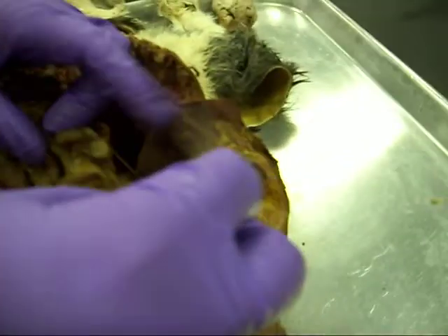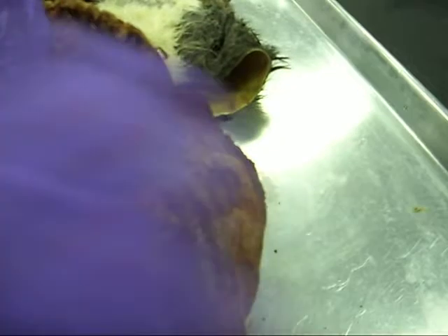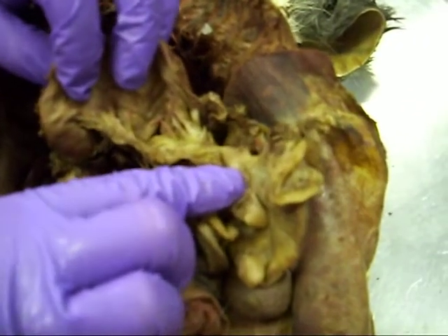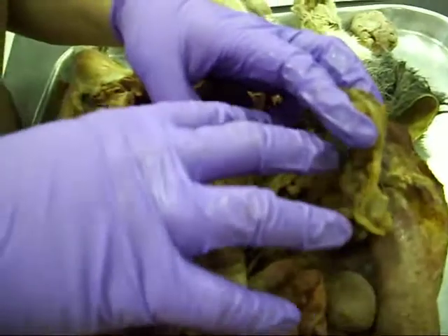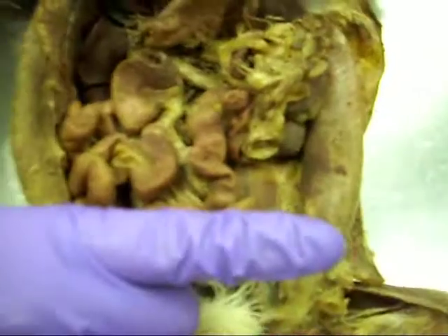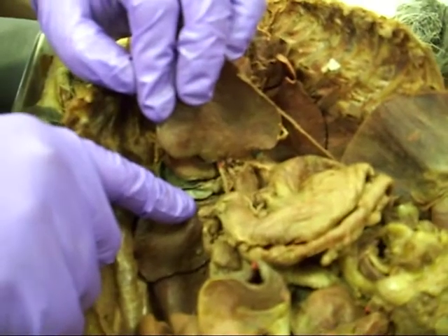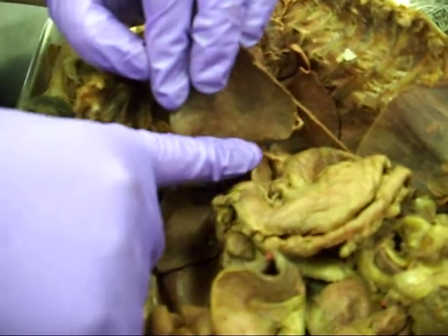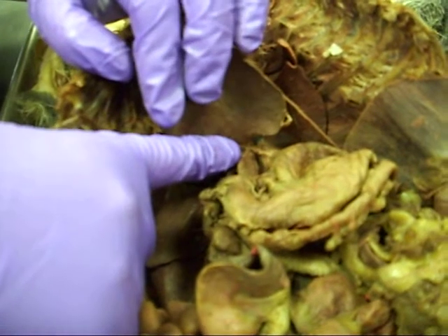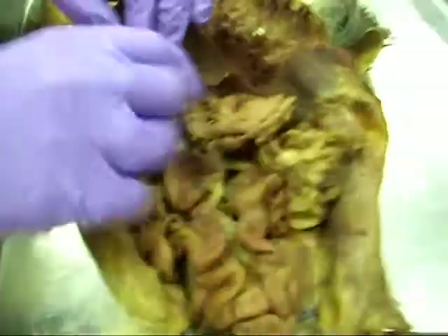This thing hanging out over here in all this fat, that thing right there is the spleen, because it's attached to the stomach by the gastrosplenic ligament. There's actually a dorsal and ventral part of that, not really easy to see in this cat. Remember when we tore away the greater omentum on top of this — that was the greater omentum. This is the gastrosplenic ligament. We had to tear away the lesser omentum in order to get at our ducts. So we tore away two of the ligaments — the hepatoduodenal and the gastrohepatic — look it up to be sure.